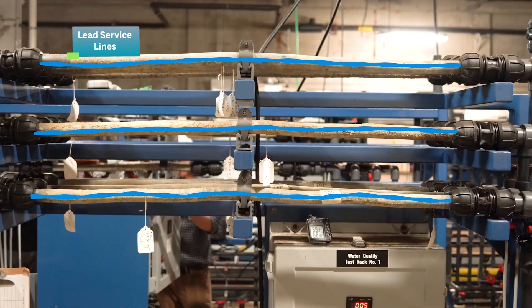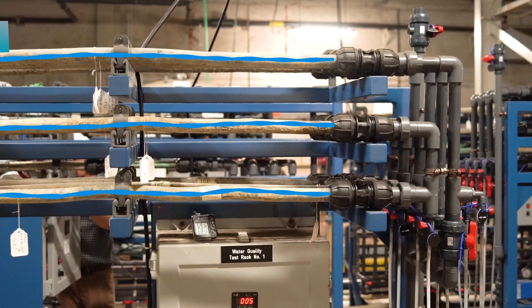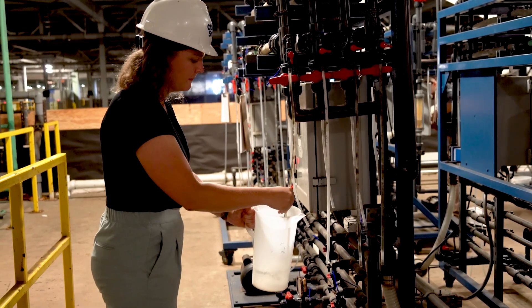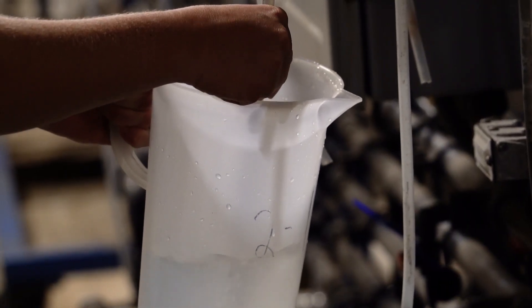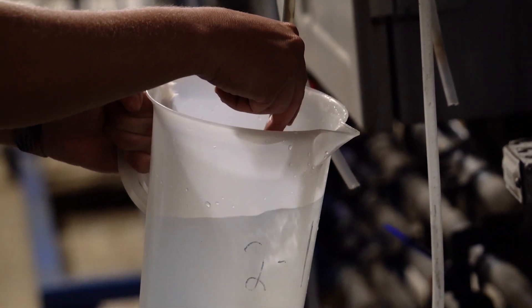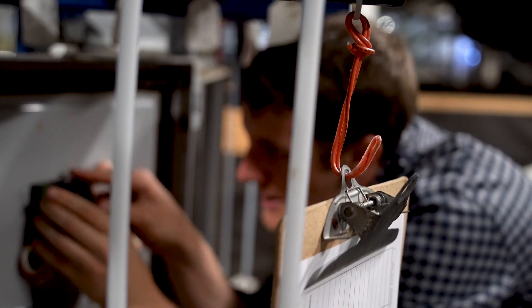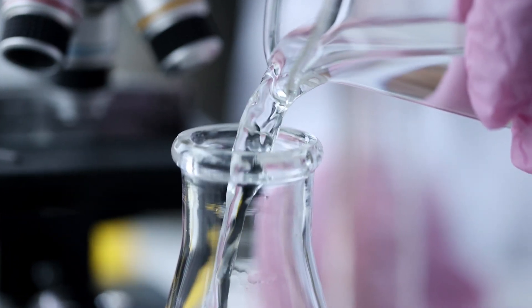The methods by which water is conveyed to the pipe loops will vary for every utility based on where the pipe loops are stored and the water source being used. Typically, utilities need to pull from their existing finished water and from a point in treatment prior to the addition of a corrosion inhibitor, in order to test different treatment techniques without interference from existing corrosion control practices. When sampling, we collect from the sample taps, take samples to a nearby wet lab for basic water quality analysis such as pH, alkalinity, and chlorine levels, and also fill containers to send to independent testing labs for metal analytes like lead or other analytes requiring more complex analysis.